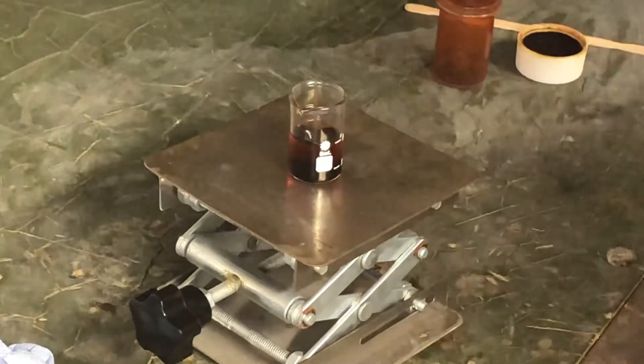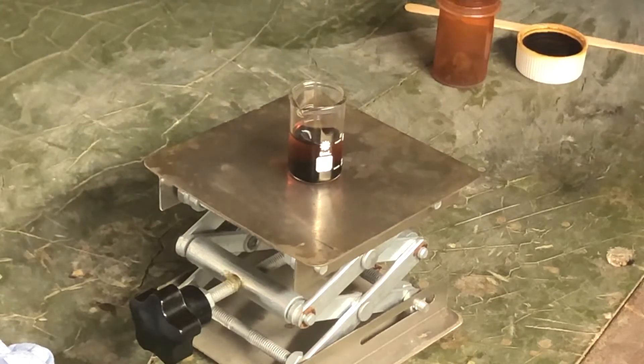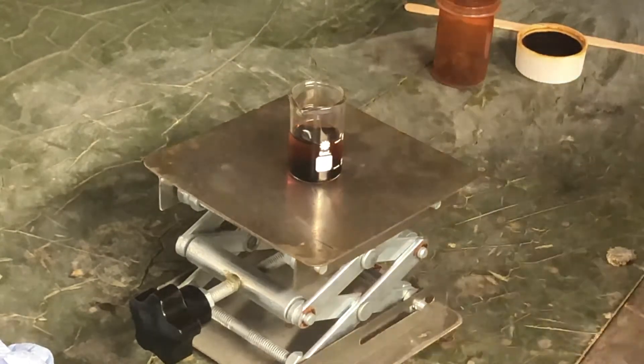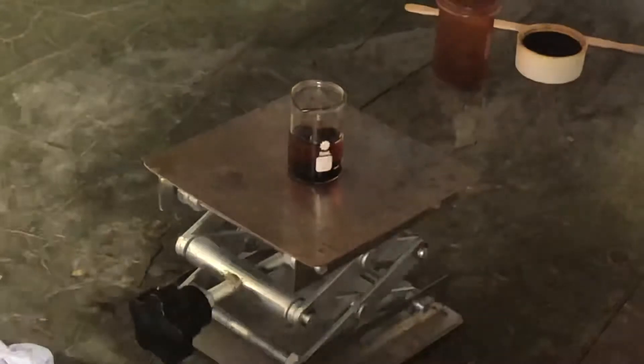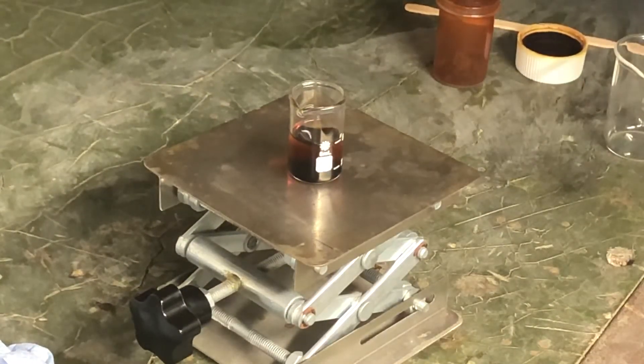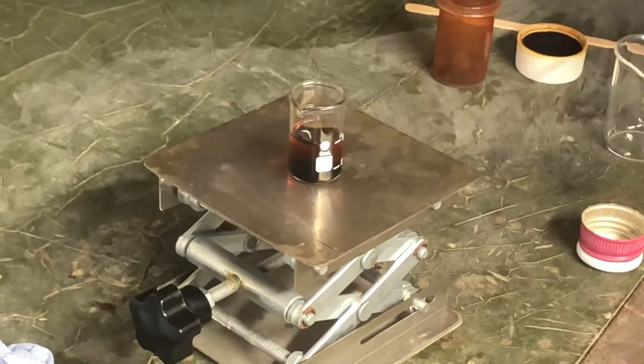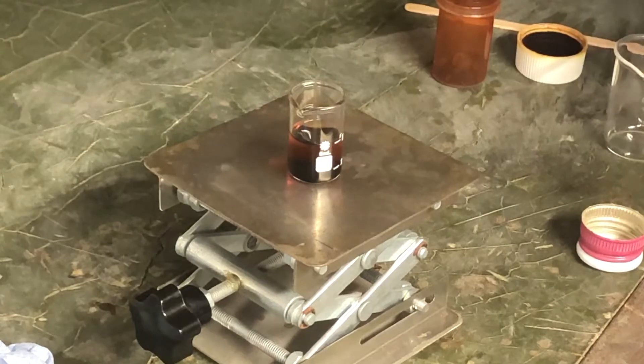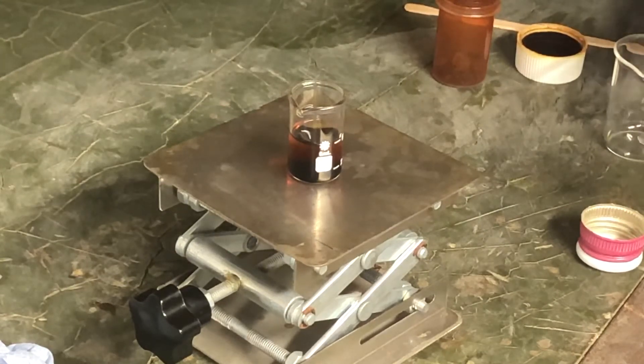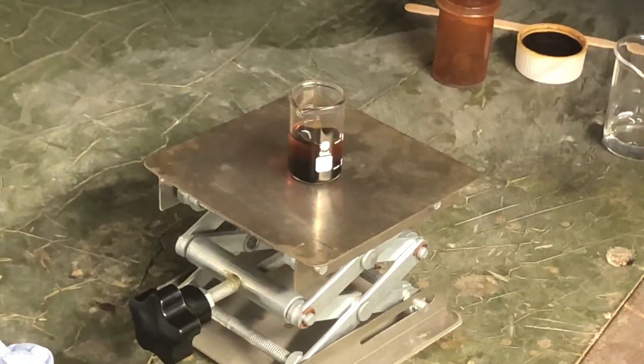So what I'm going to do quickly, let's pick phosphoric acid because it's just an interesting acid. I'm going to be pouring a very small amount into this. We just need a slight amount of H plus ions because that can form the enol form of our acetone and that can be reacted with our iodine, which is cool.